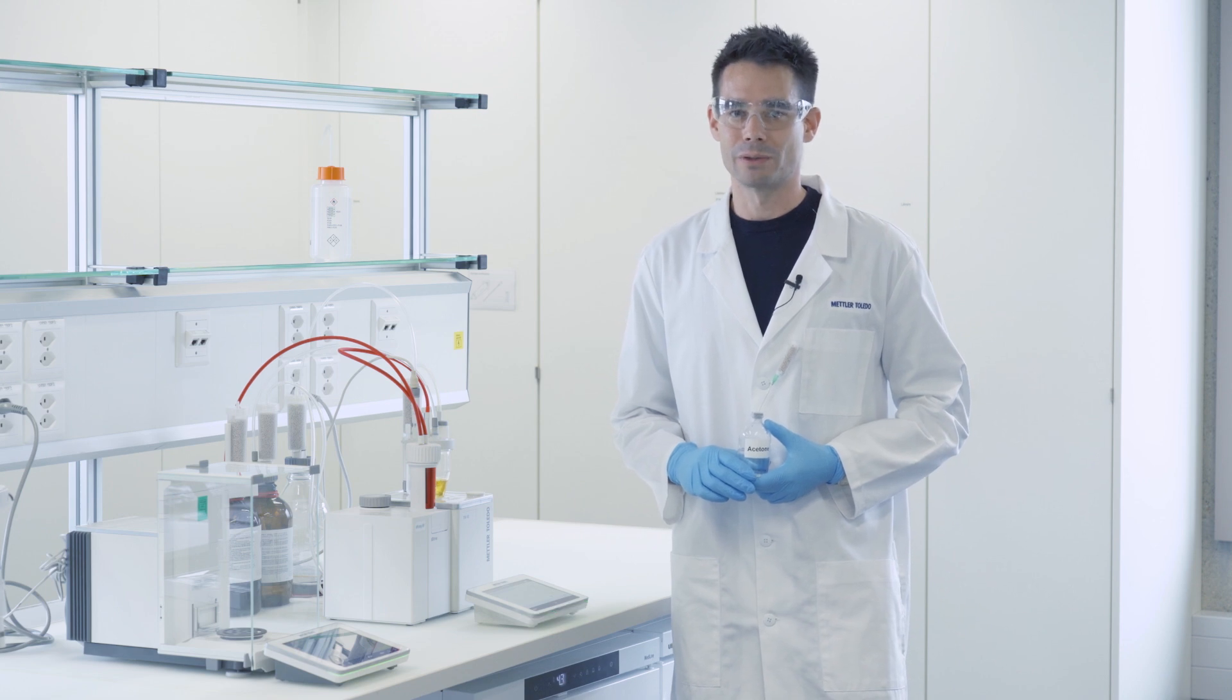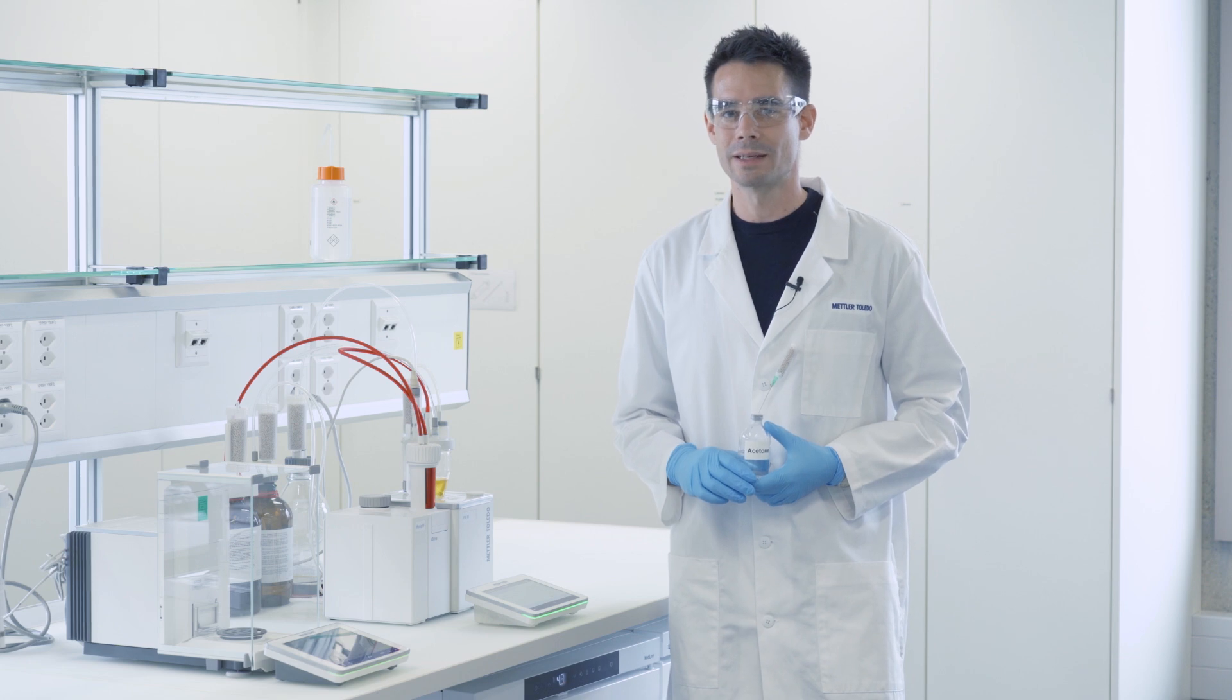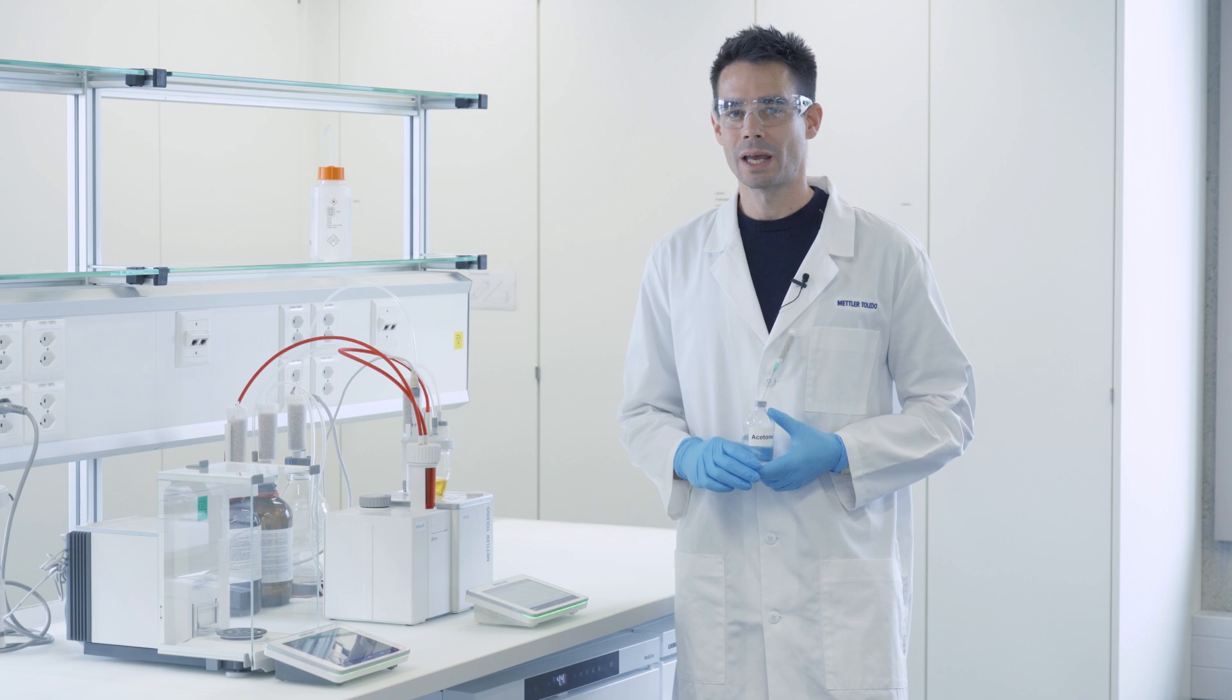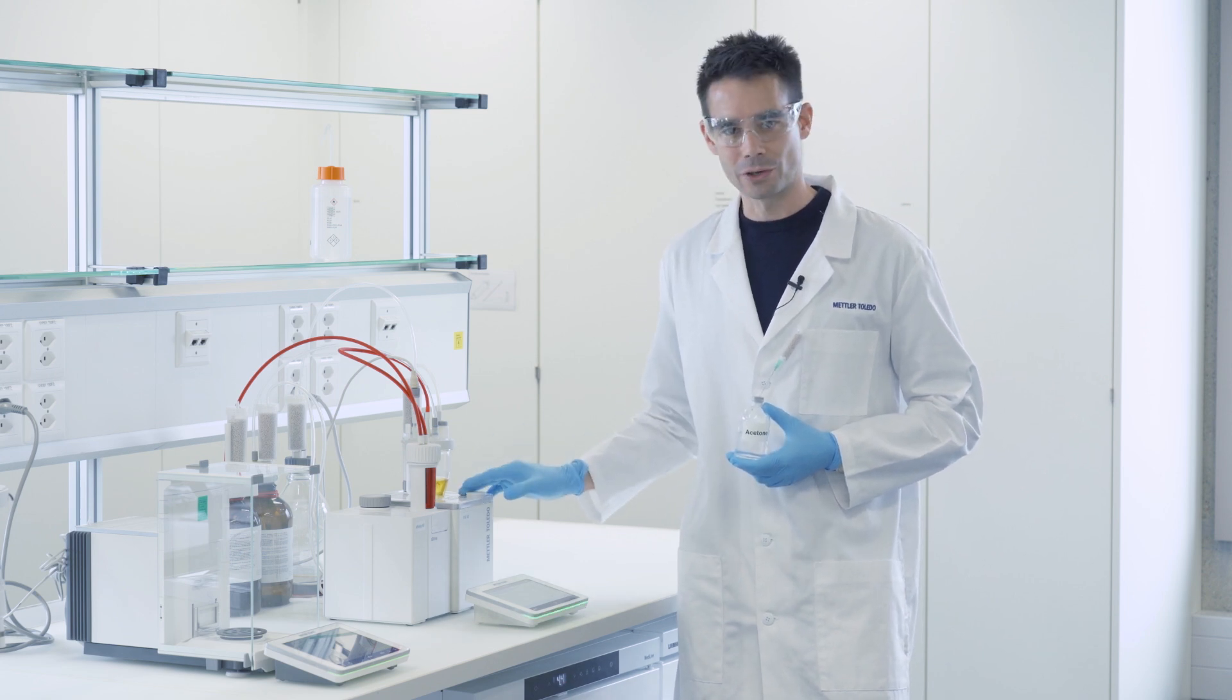Today I'm going to show you how to determine the water content in samples that contain ketones and aldehydes, such as for example acetone. We will do this on an EVA volumetric Karl Fischer titrator.